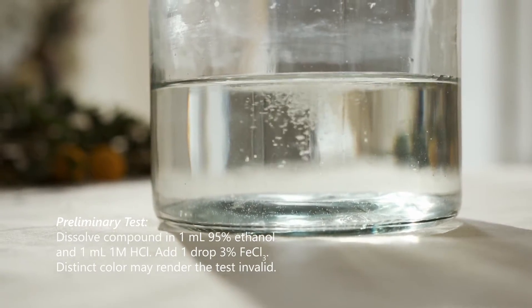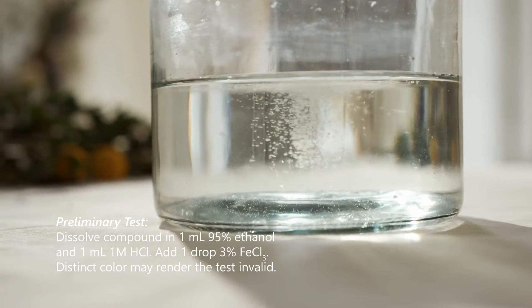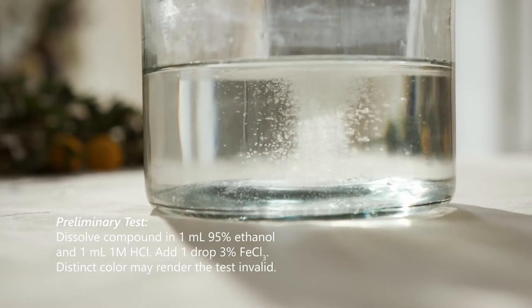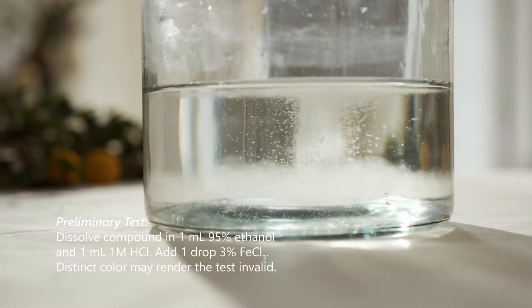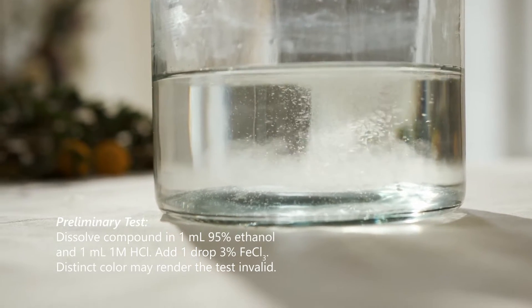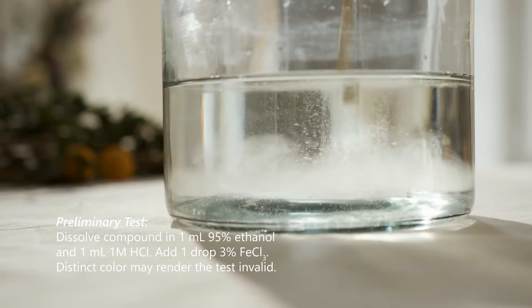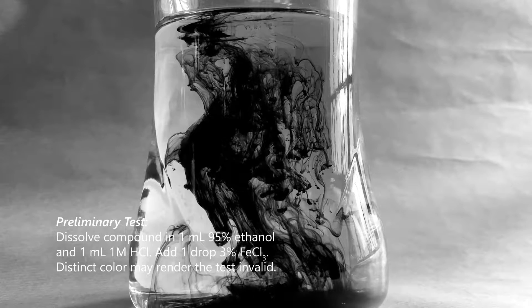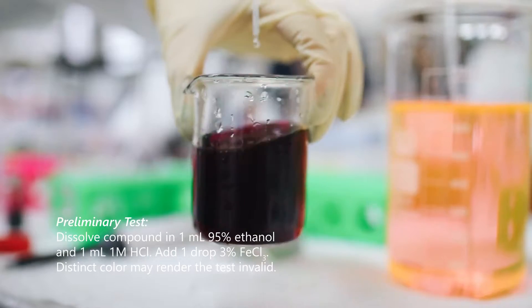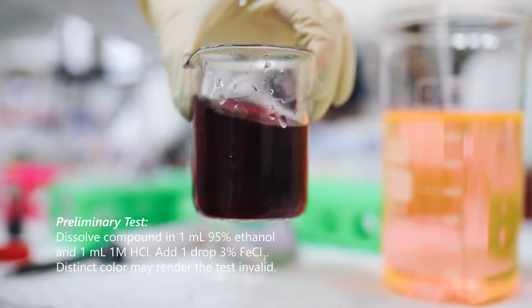Prior to testing, screen your sample by dissolving it in 1 ml of 95% ethanol with 1 ml 1 molar hydrochloric acid. Add a drop of 3% ferric chloride. If a distinct color is produced, note that this test may be invalid. Proceed with testing.